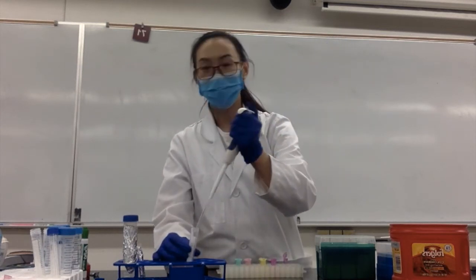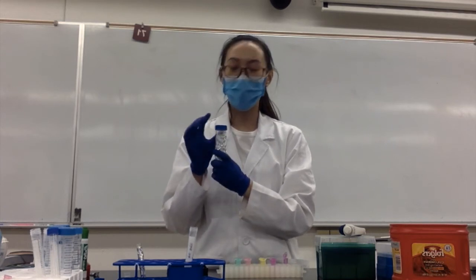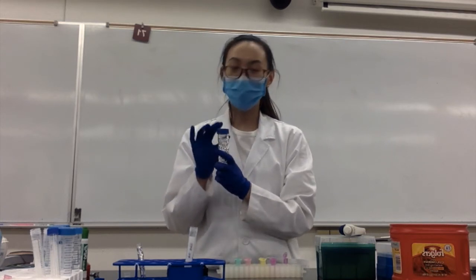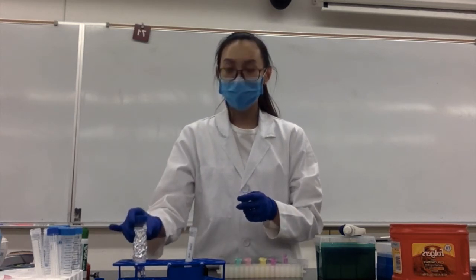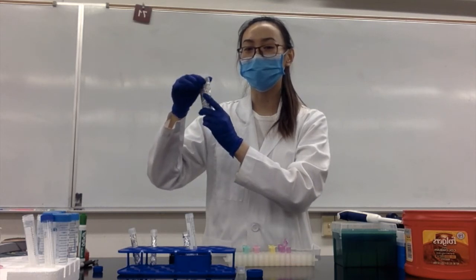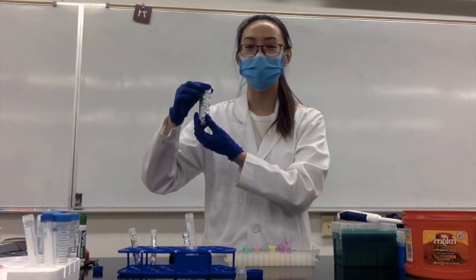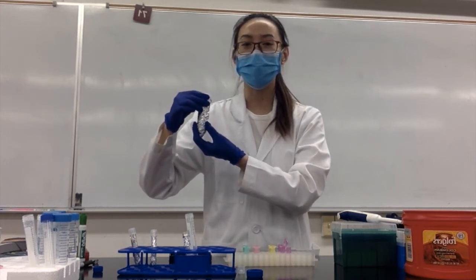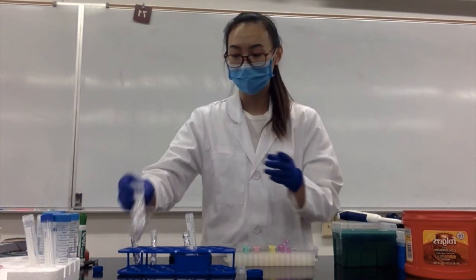Discard to the waste container and discard the tip. Next, we need to make the DHE solution — I've already made this for you. I added PBS and DHE into this tube and mixed them together. I'm using aluminum foil to wrap up this falcon tube because the DHE dye is light sensitive, so the foil protects it.